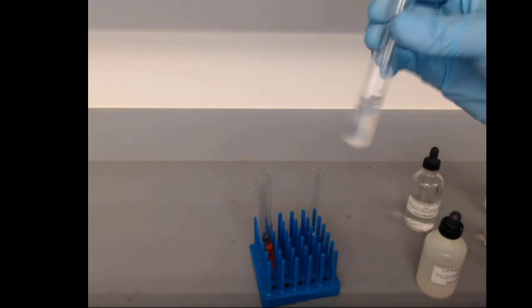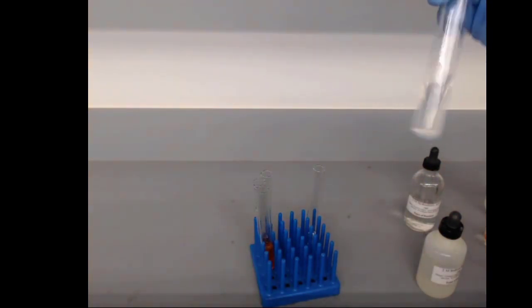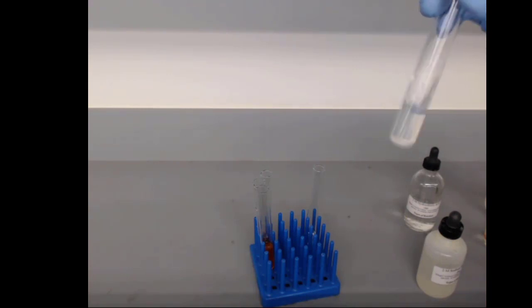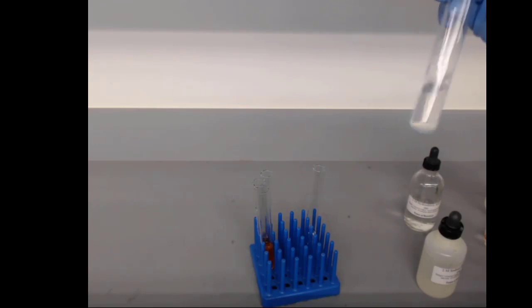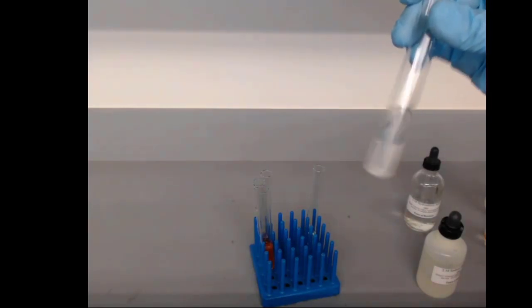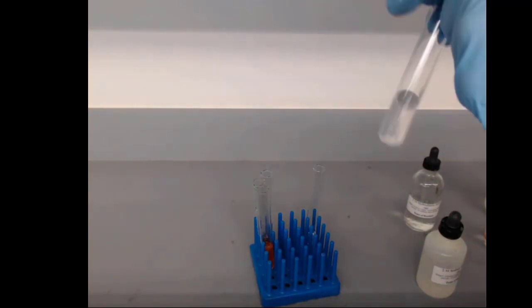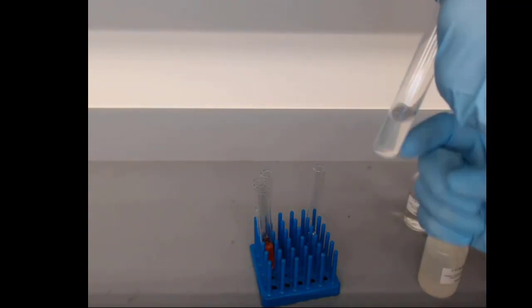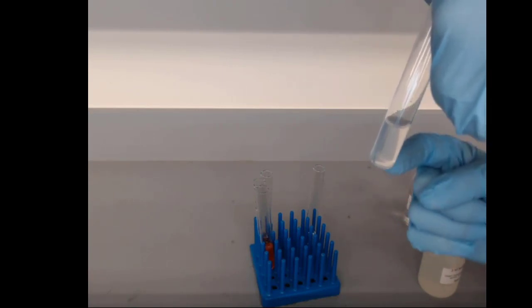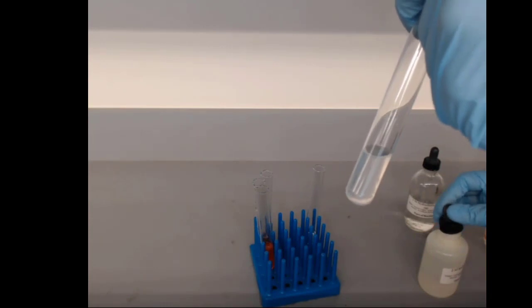So acetic acid is one of those funny compounds that goes by many different names. Acetic acid is its common scientific name. Ethanoic acid is the correct scientific name, but most of us just call it vinegar. Acetic acid is the active part of vinegar. And so we can see that it's acidic conditions. I added phenolphthalein. It's got that little bit of cloudiness, but it's still not pink.